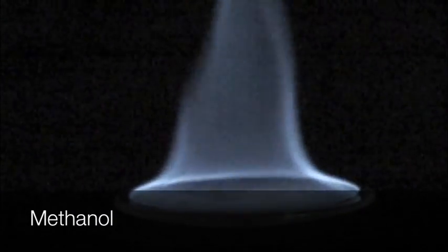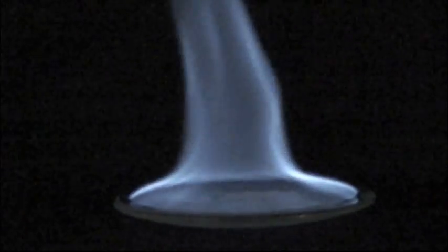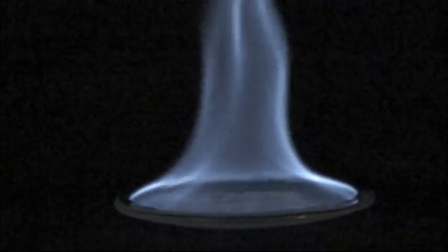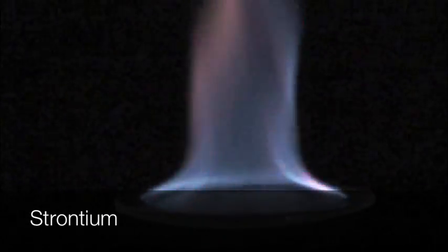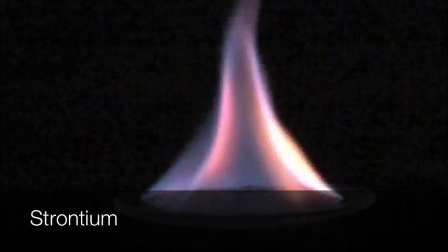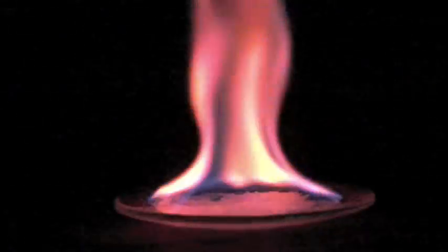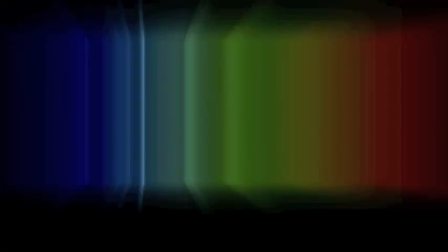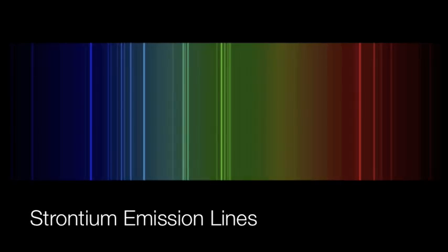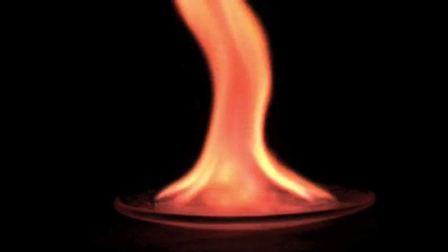First we burn methanol by itself so that you can see what color the salt is not causing. Next, a metallic salt is added to the methanol. The added color is due to the atomic emission spectrum of the metal. This is also the reason that elements can be distinguished using a simple flame test.